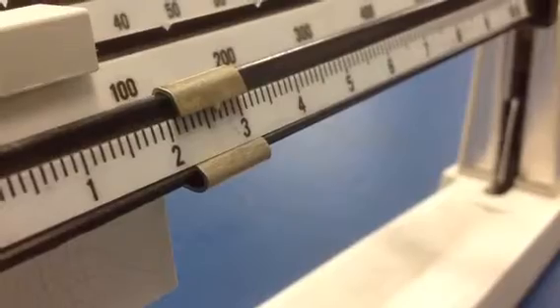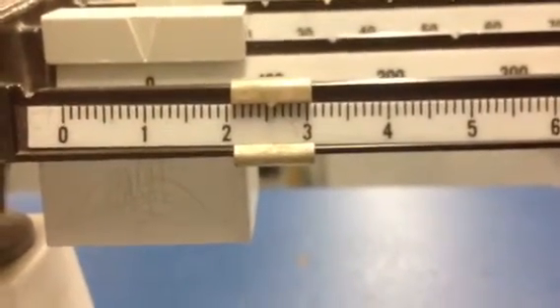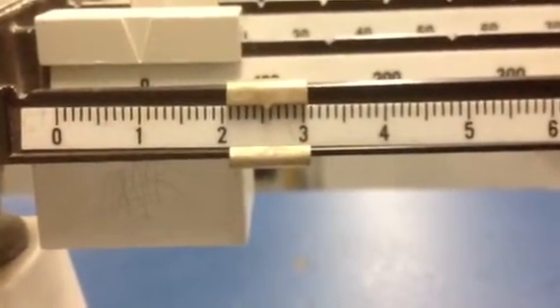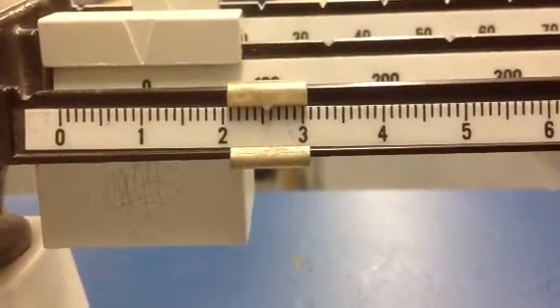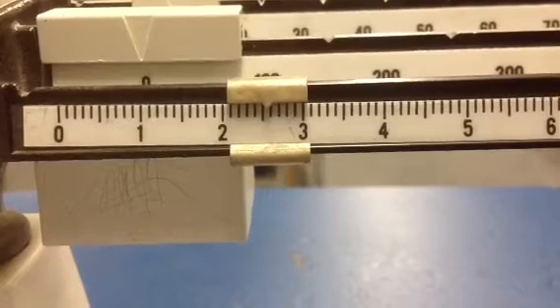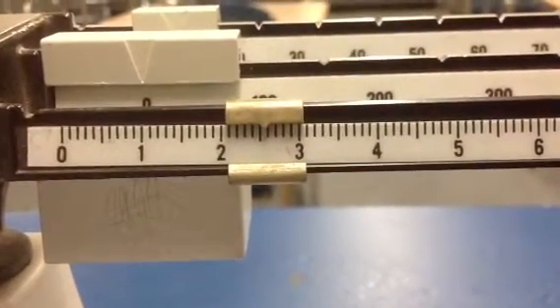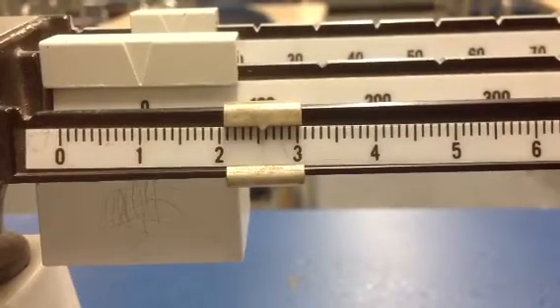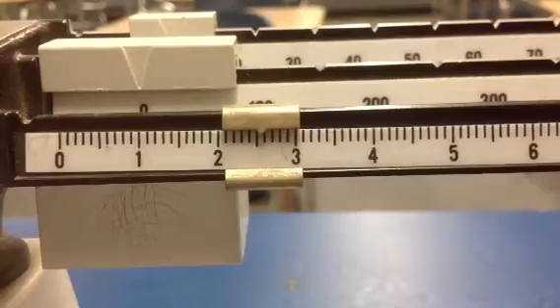The best way to circumvent parallax errors is to look at something front and center, which is fairly obvious, but sometimes you forget it. So let's just think about this here. If I look at it from straight and center, what I find is that it looks like about maybe 2.56 grams. So the main way to avoid parallax errors is to look at things straight and level. Parallax errors basically are caused when you look at things from an angle.